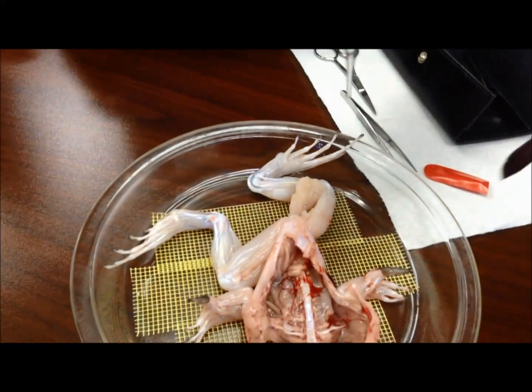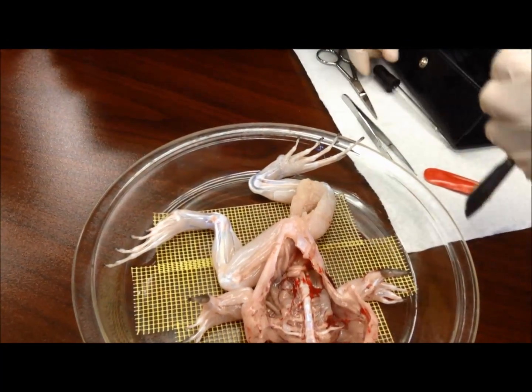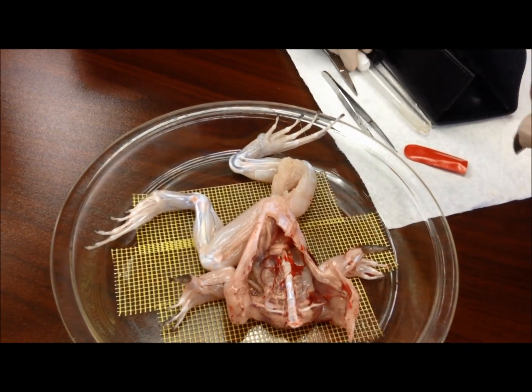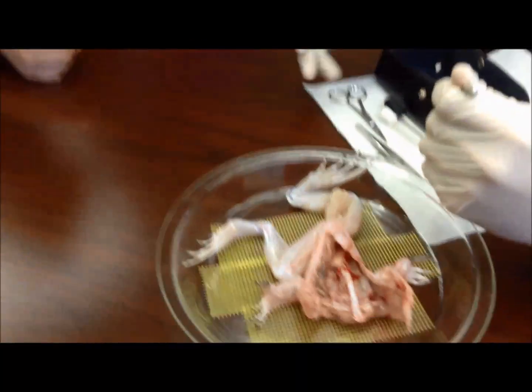The thing with buying these frogs and having them already dissected for you is that the muscle can die really fast because of lack of blood — does that make sense? And also lack of ions, which is what we're adding right here. So not only does it have calcium in there, it also has other things like sodium, magnesium, potassium.